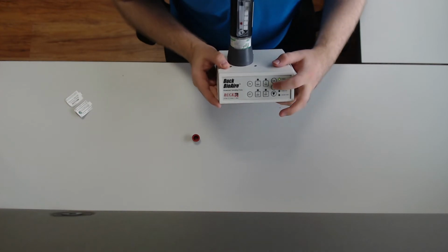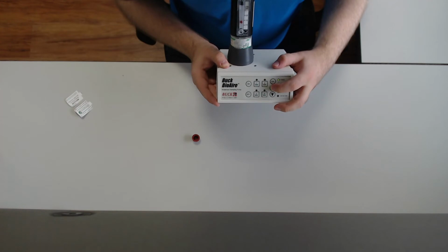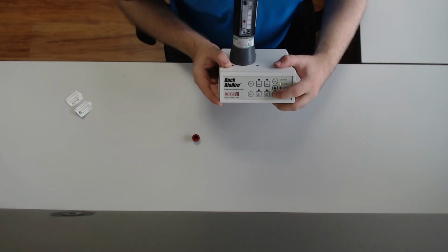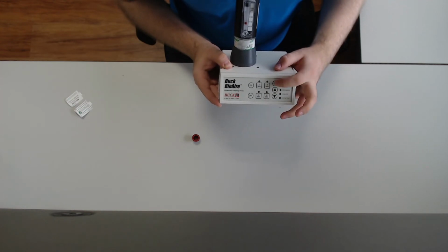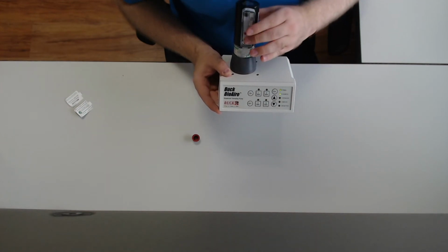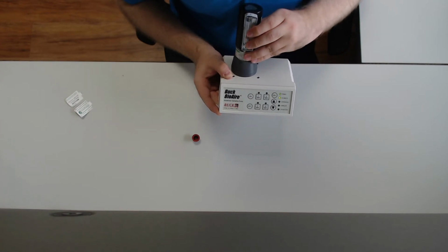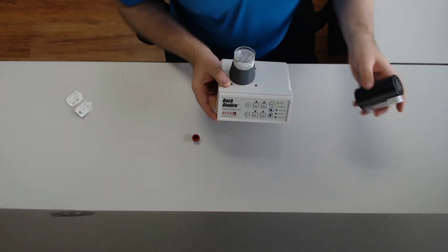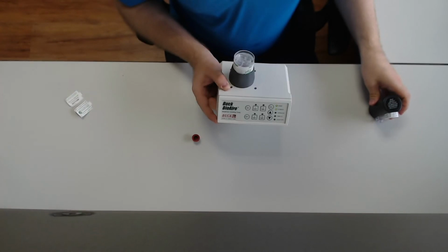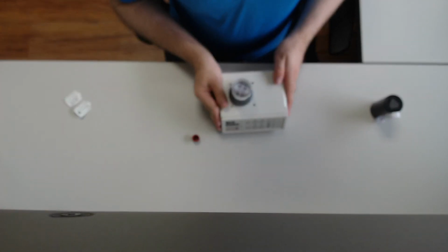Step 6. Adjust the flow rate by using the up and down arrows until the center of the ball in the rotometer is at the 15 mark. Press the Cal button again to accept the setting. Remove the rotometer. Bear in mind that bumping or moving the pump may change the flow rate. The flow rate is also affected by the presence of the cassette, so it's important to adjust the rate after the cassette is attached.